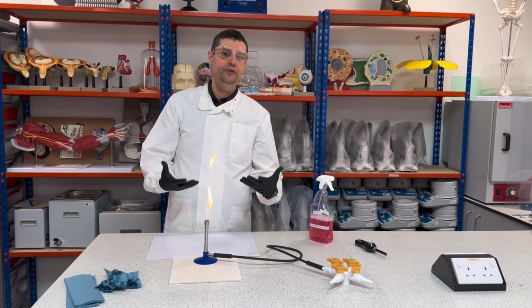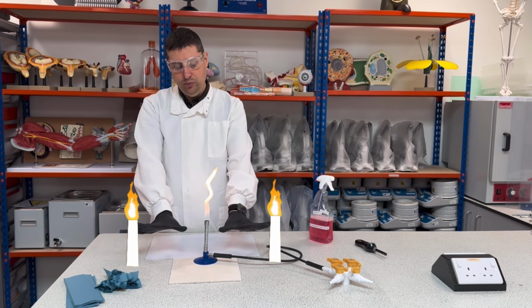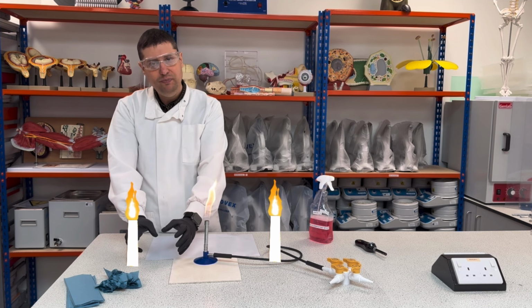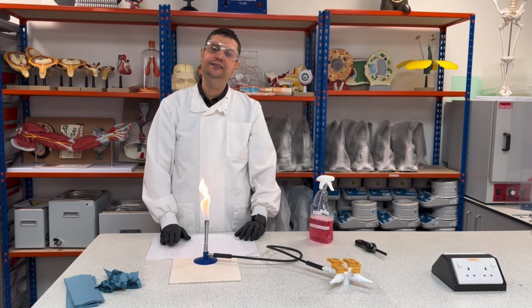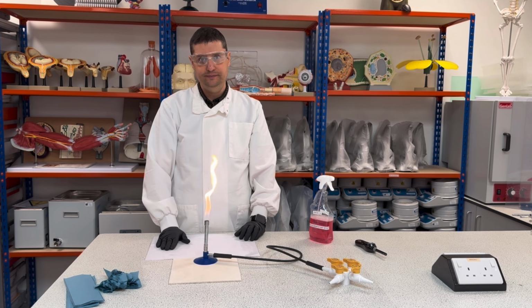If you don't feel confident enough to work with just 10 centimeters, you can work with another Bunsen burner on the side, so you're going to have two sterile areas added. So we need one here, so we have a big area to work in the middle. After this is all disinfected, I can start to inoculate my bacteria.